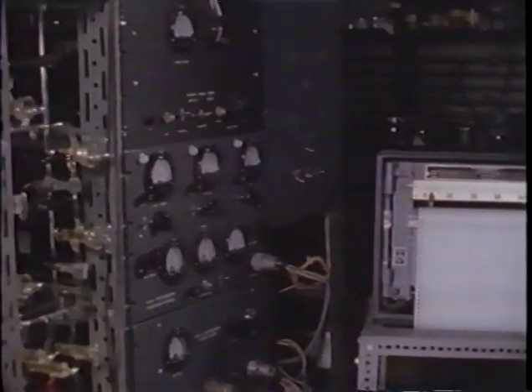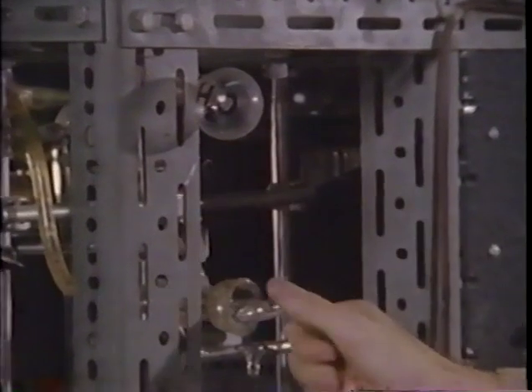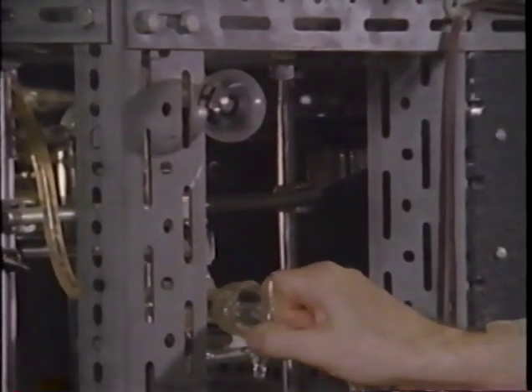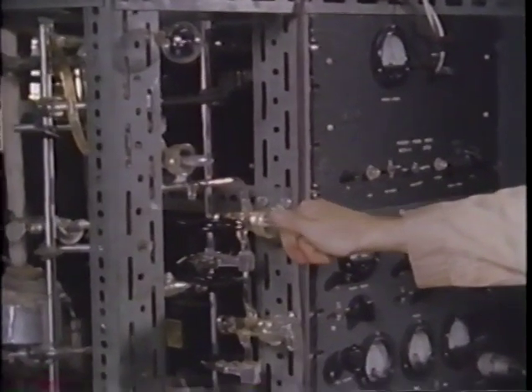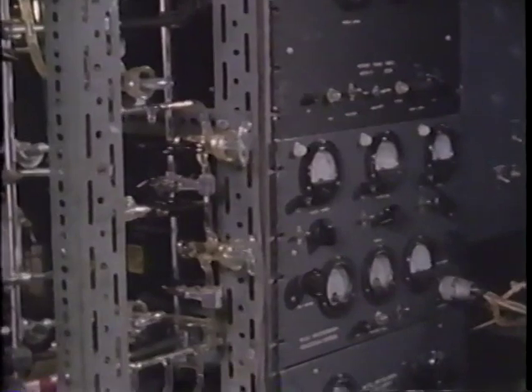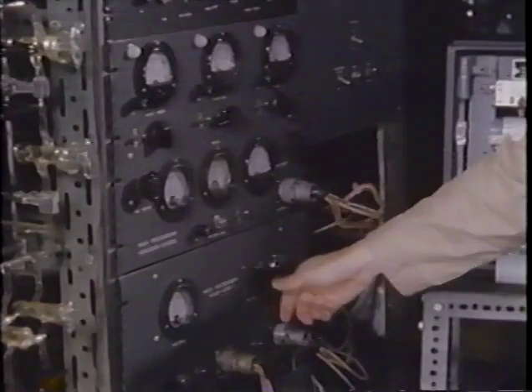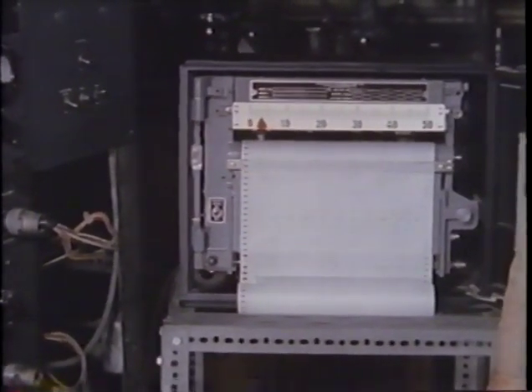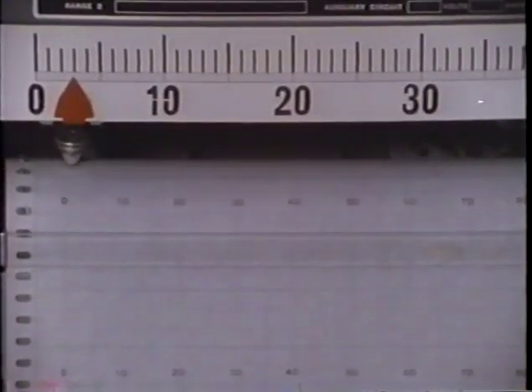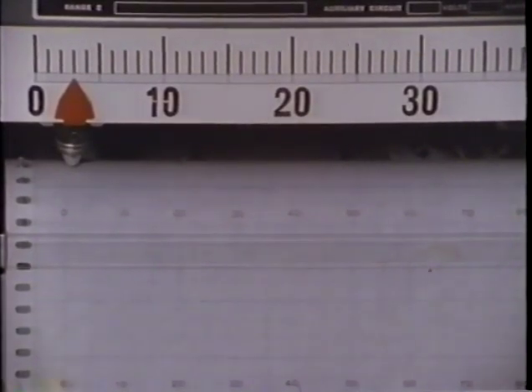This mass spectrometer will detect the oxygen isotopes in water. First, a flask containing some ordinary water is connected to a vacuum system and the air pumped out. Water vapor from the flask is introduced into the spectrometer where it is ionized and passed through a combination of varying electrical and magnetic fields, then strikes the detector. An electrical impulse from the detector is transmitted to this pen, which moves to the right when ions of each mass strike the detector. The more ions that strike the detector, the further the pen moves to the right.